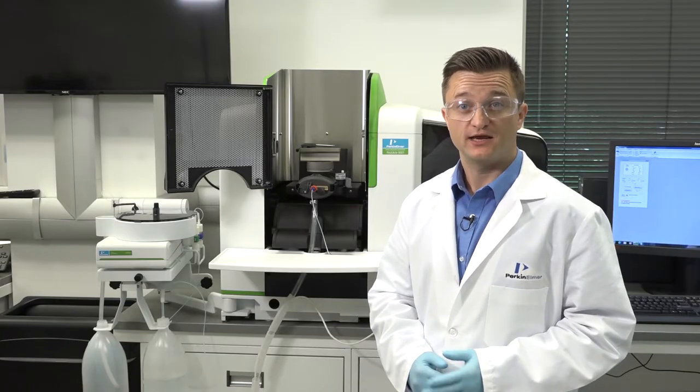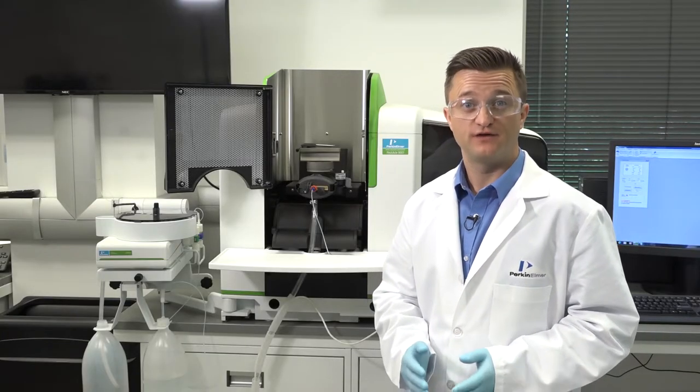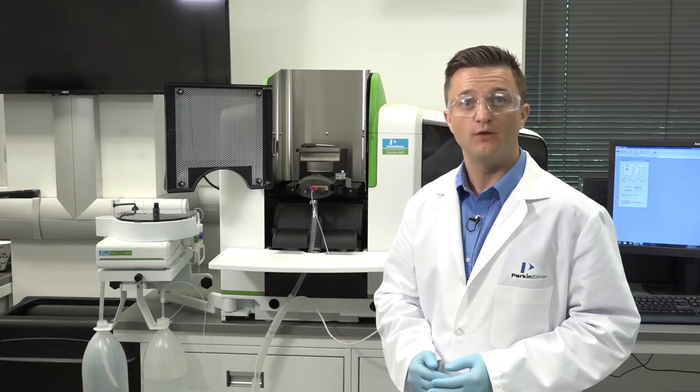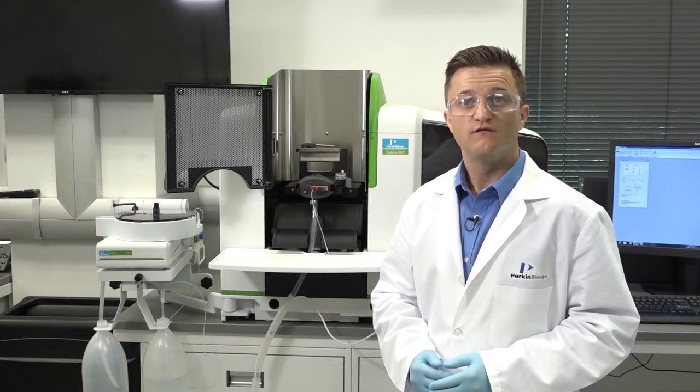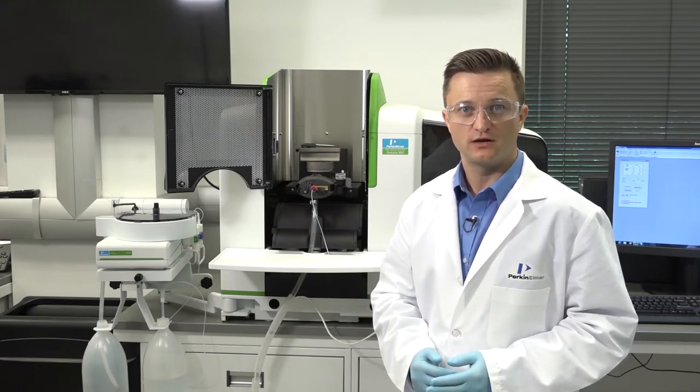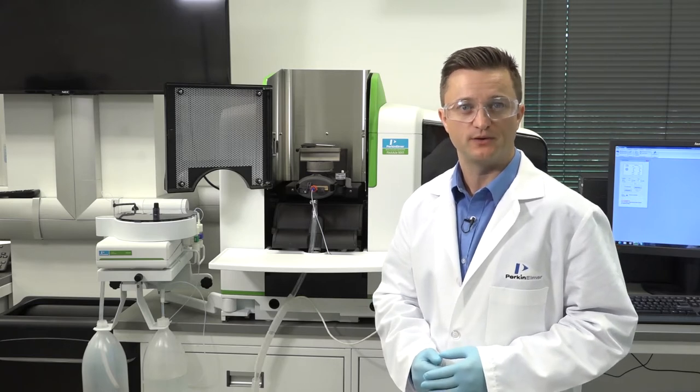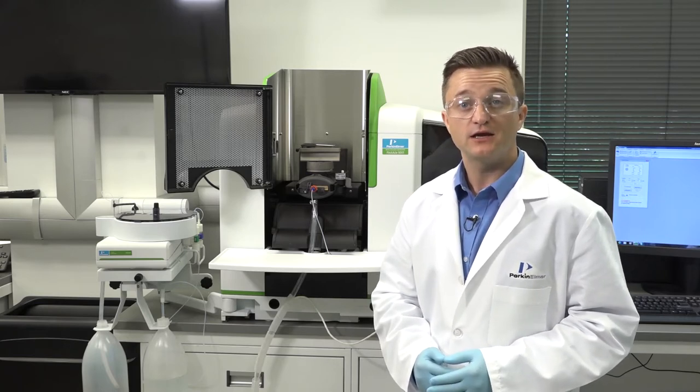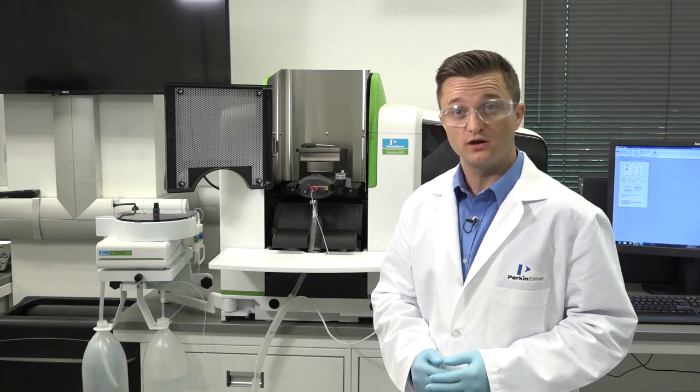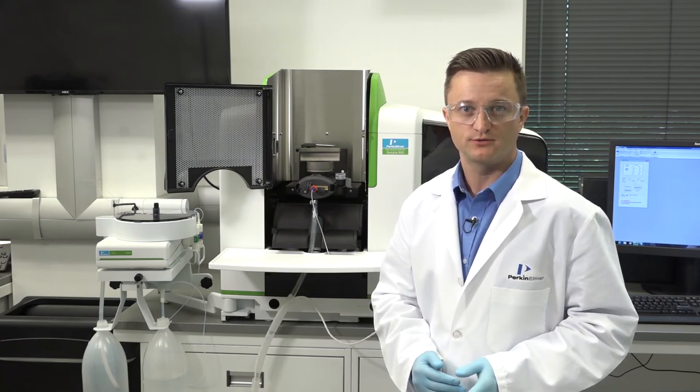The PerkinElmer AA instrument manual and these how-to videos are great resources to help get you familiar with your AA instrument. For more in-depth information on how to properly maintain and use your Pinnacle AA system, sign up for one of our training courses or contact your PerkinElmer representative for additional options.